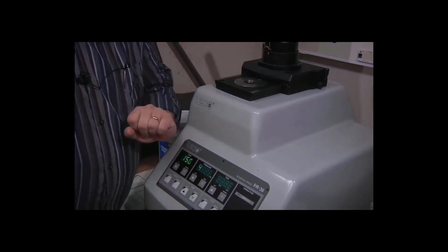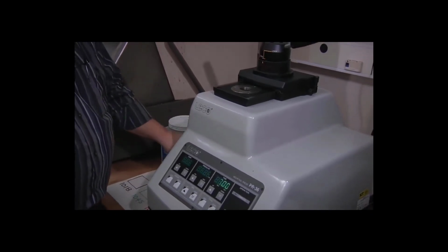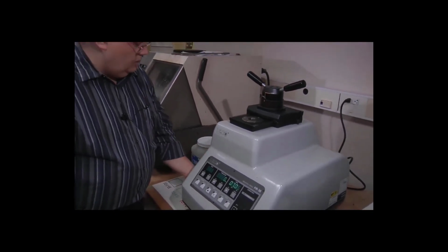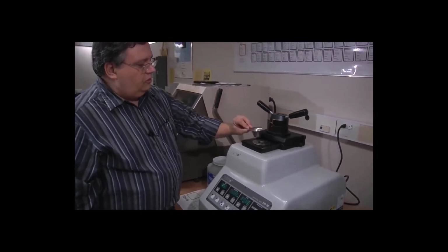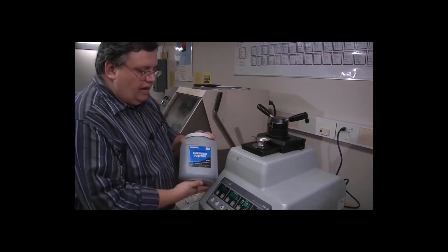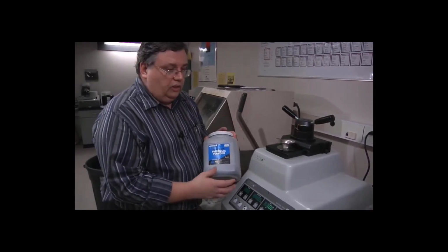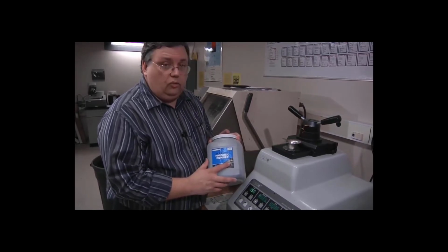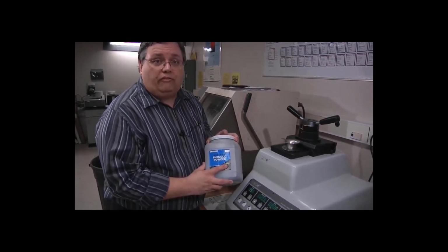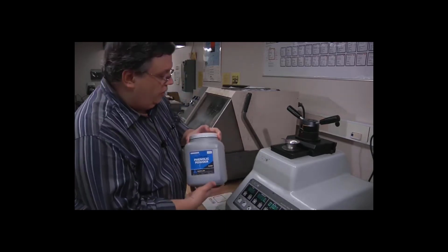There. So the specimen's at the bottom, and we're ready to load the powder that will make the plastic puck. So I insert the funnel into the cylinder. For 1018, as you recall, we're color coding our specimens. So 1018 goes into a black puck, 1045 goes into green, 1095 goes into red. So here's my black powder.